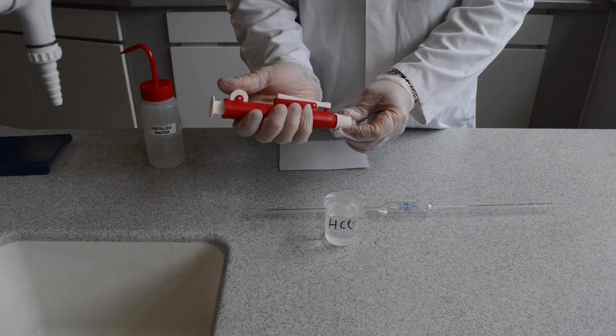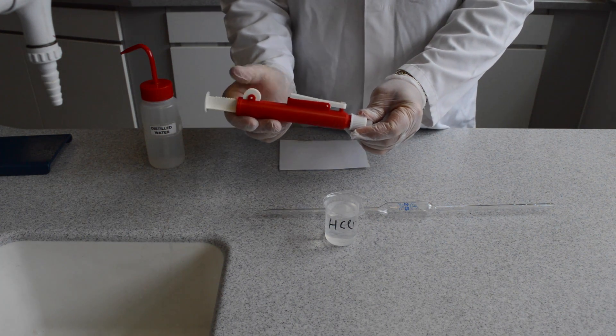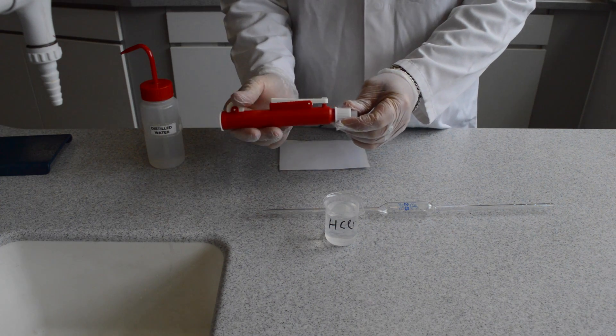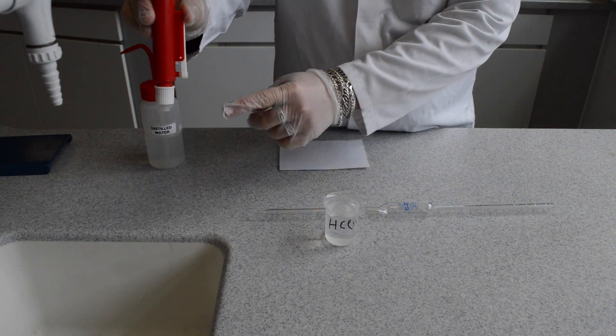Conditioning equipment. Using a pipette filler. Use the wheel, do not pull the plunger. To release liquid from the pipette, please use the release valve on the pipette filler as shown.